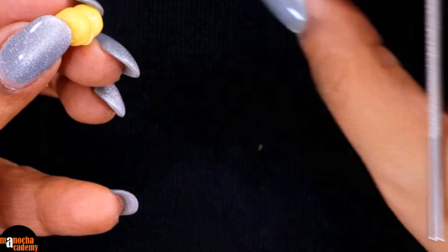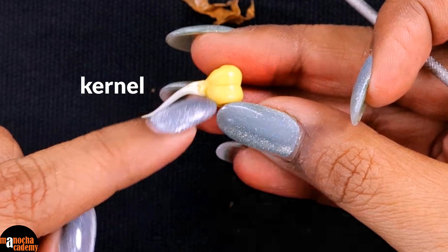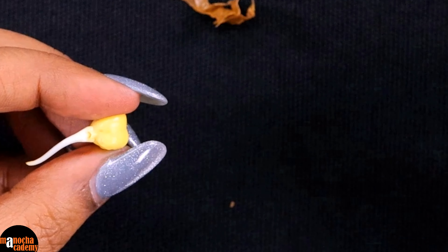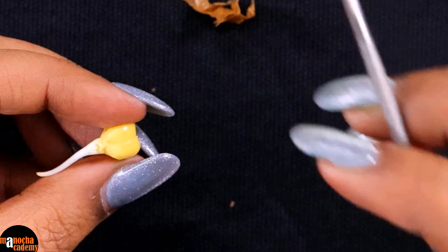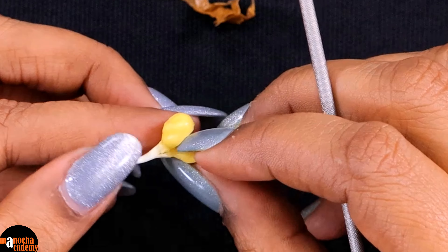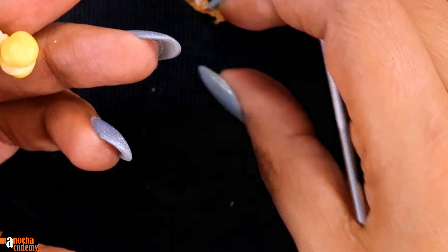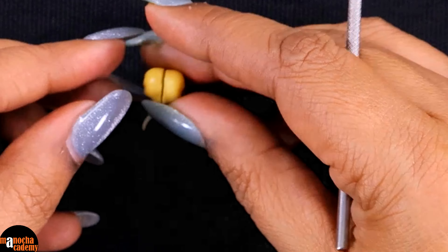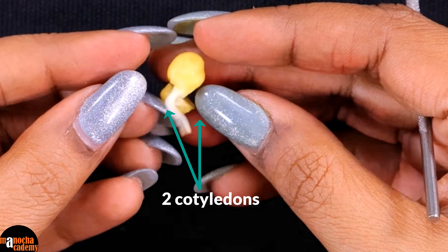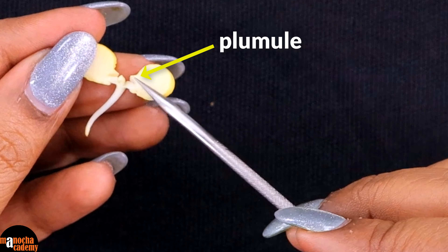Once I have taken out the seed coat, what I am left with is known as the kernel. The kernel consists of these two cotyledons, which are responsible for storing food, and the radicle that is coming out — that is the future plant, which is the embryo. I am going to simply press the two cotyledons and you will see them open up. When you open it up, you can see this is the cotyledon, and you can see the plumule right here at the centre.